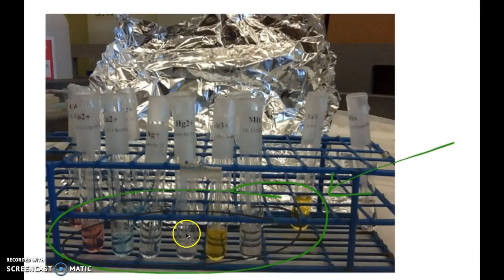So your sample is going to come in this form right here. You notice that what the stock room has done here is provided all the different ions names on it. And then there's also something called a mix, which remember is all of the ions combined together. And if you can see through here, you can see that there's some of these tubes inside each of the test tubes. Those are called capillary tubes.